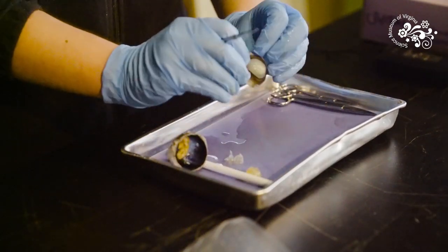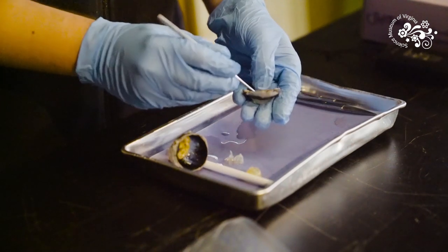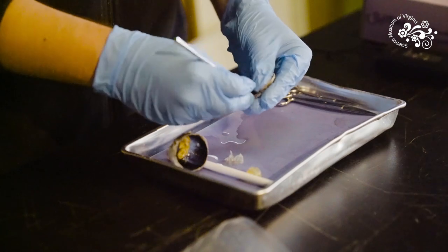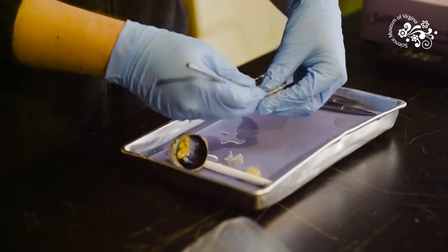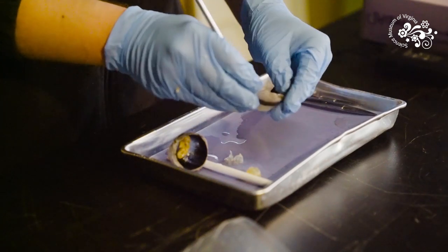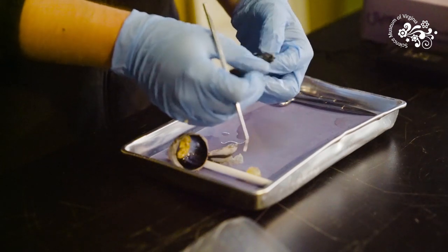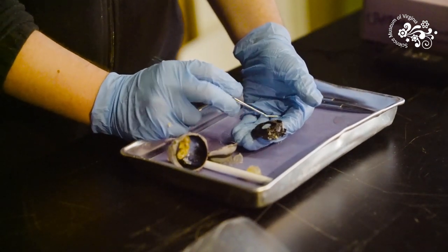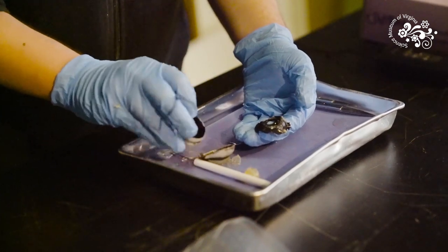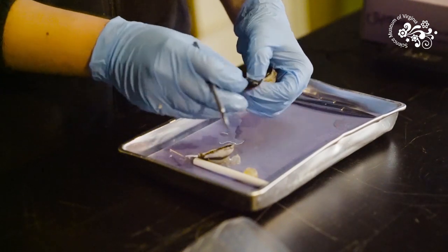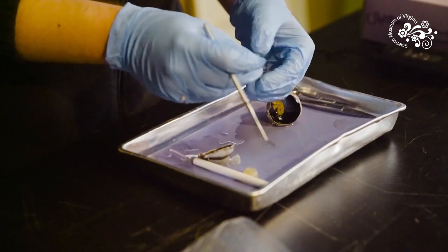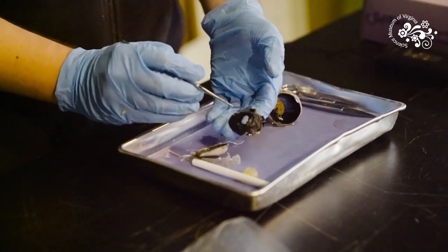Back up in the front we have one part left to see. Right behind the cornea attached to it is your iris that gives your eye its color. The iris can be peeled away by slipping this little dull probe under there and then scraping this around in a circle. In cow eyes, the only color eye you ever see are these really deep dark brown ones. But the point of the iris is not to give your eye pretty color, it's to control how much light is reaching the retina in the back. The hole in the iris here is your pupil. The pupil is not a physical part of the eye you can take out, it's just the absence of iris. It allows light to shine through.